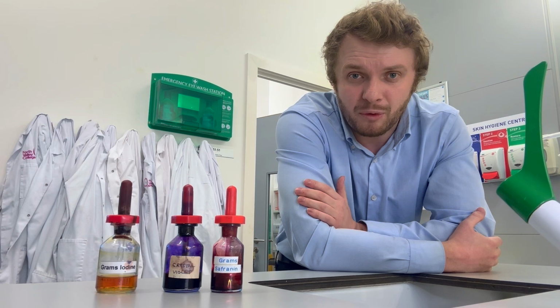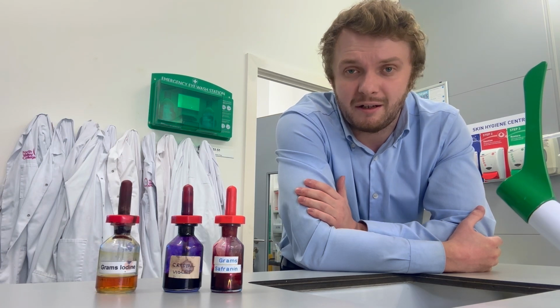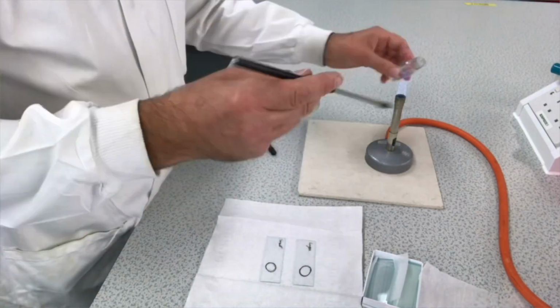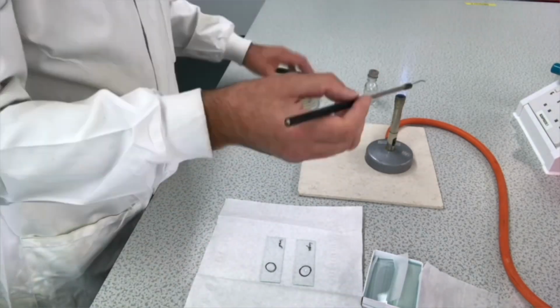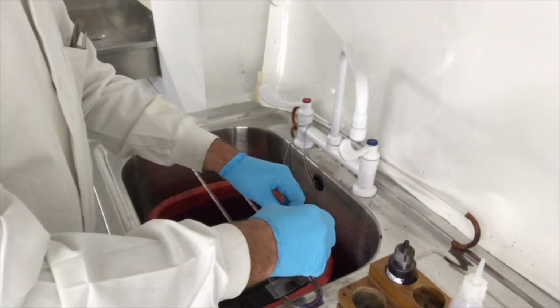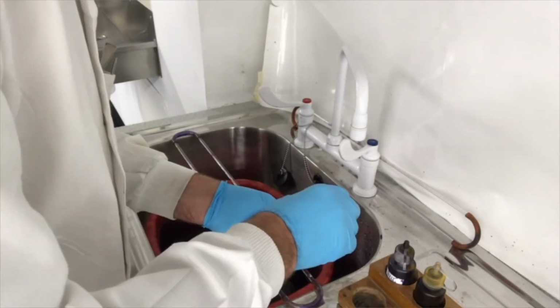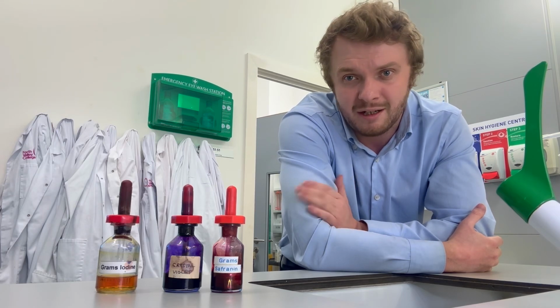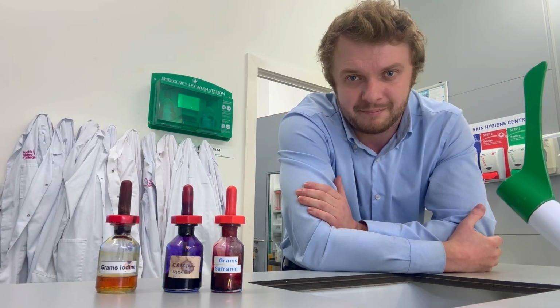As you can see from the protocol, stage 3 involves the chance to conduct both SIM motility testing and a gram stain. A more detailed video resource describing these protocols is available and includes some suggestions on how these techniques, which are made reference to in both the Higher Human Biology and Advanced Higher Biology specifications, might be best positioned within the curriculum, or even adopted to fulfill project-based coursework requirements that these qualifications entail.